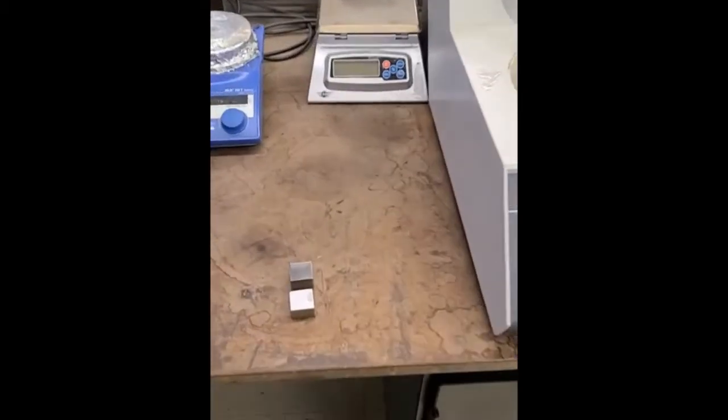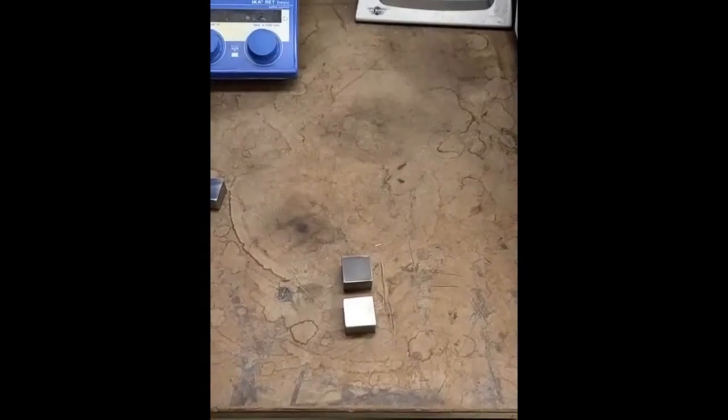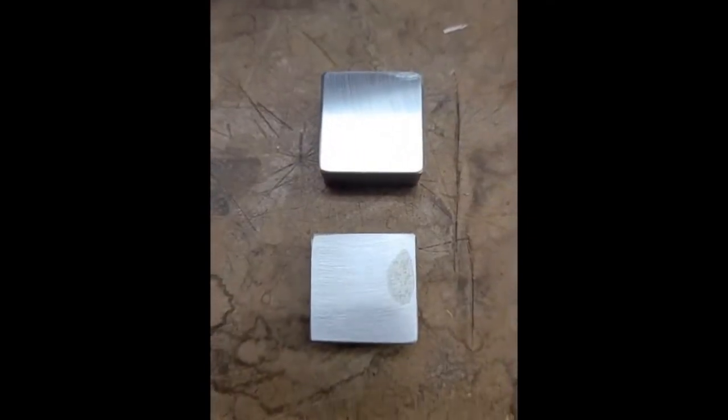Hi everyone, I'm back in the undergrad lab and I'm polishing our samples. I'm doing the same sort of procedure I did with our aluminum samples. It's a lot more difficult because steel is stronger than aluminum, so we'll see that in our hardness values and things like that. I also wanted to show you one other complication.